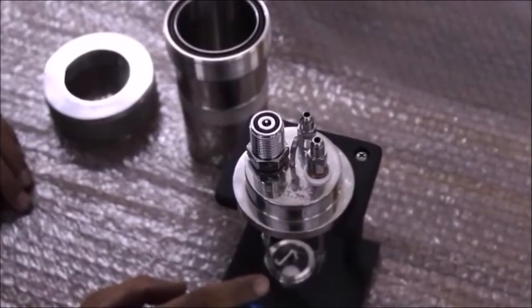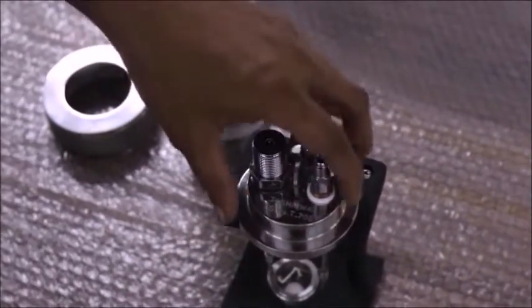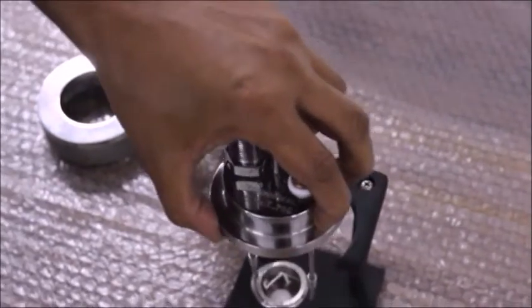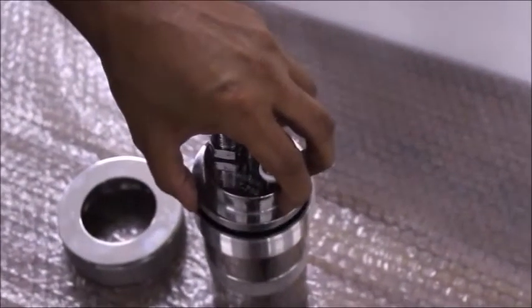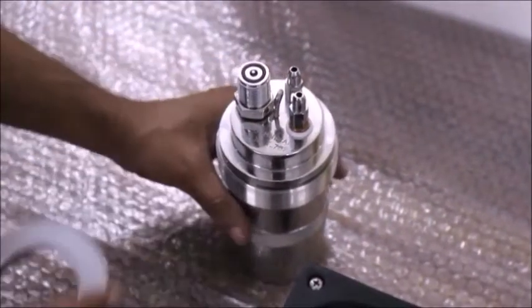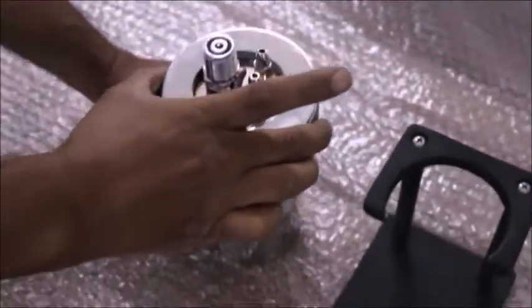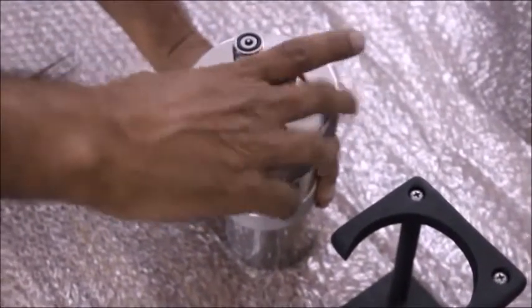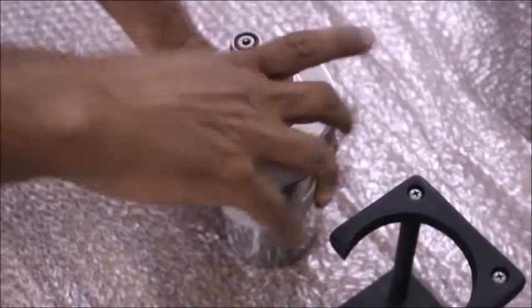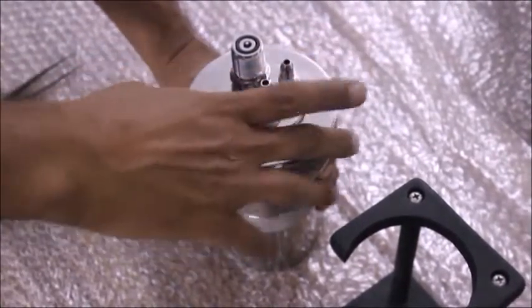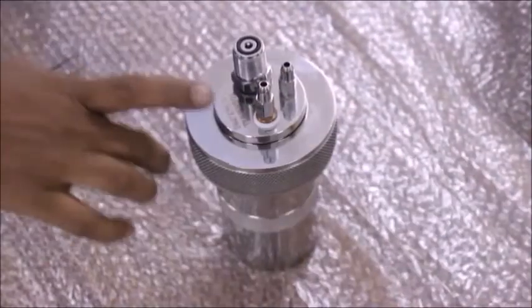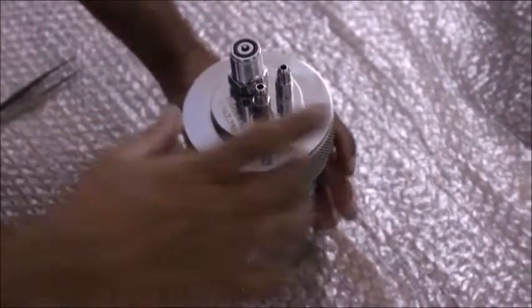Now take the bomb lid and place it inside the bomb body and close the bomb body using the bomb ring. Make sure the bomb ring is hand tight.